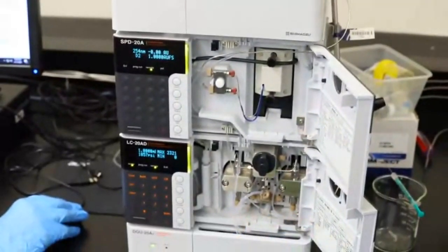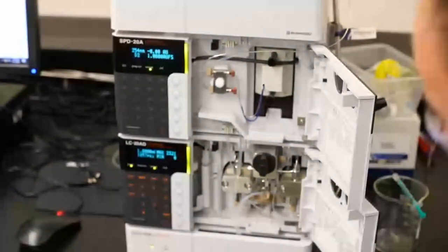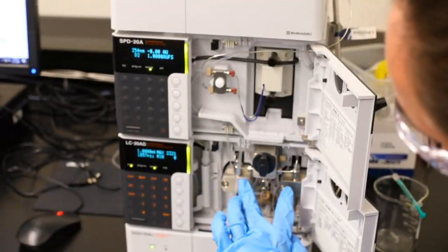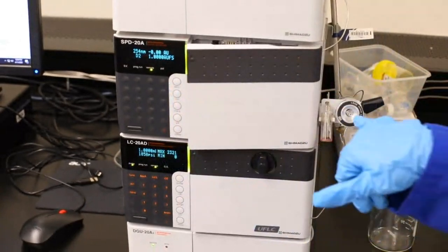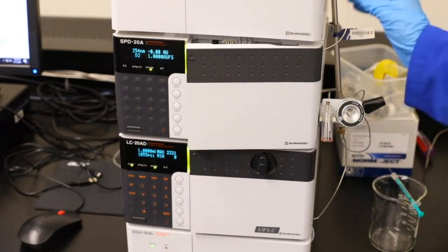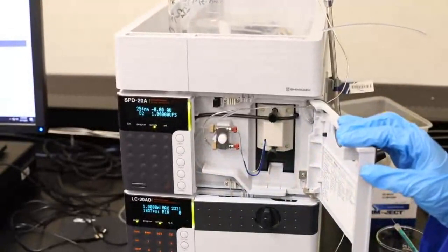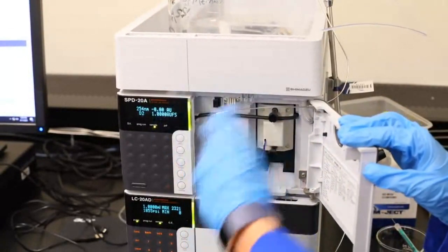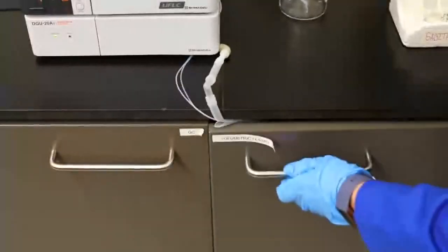Now you've got to make sure that you don't have any bubbles in our mobile phase because it can actually cause problems with our column and even rupture it, which you really don't want because they're about $1,000 each. It comes up through here, gets split, and comes around to here where our injecting side is. So you simply load it into here, then goes down to the bottom, up through the column. So this is where our stationary phase is, the column over here, and then comes around to here where our detector is. In this case, we have a UV detector. And then from there, any of the waste that isn't used goes through here and down into our waste container.